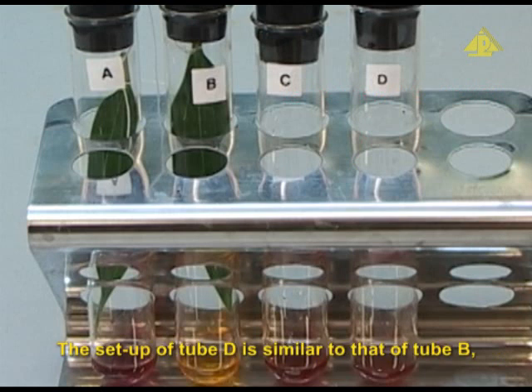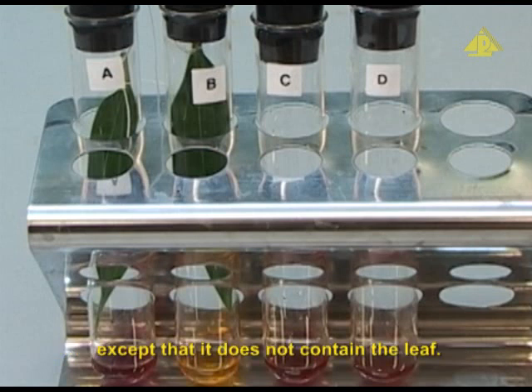The setup of tube D is similar to that of tube B, except that it does not contain the leaf. It is used as the control.